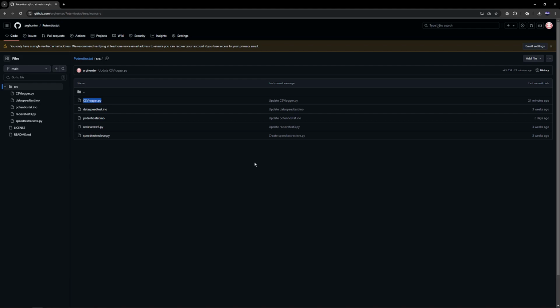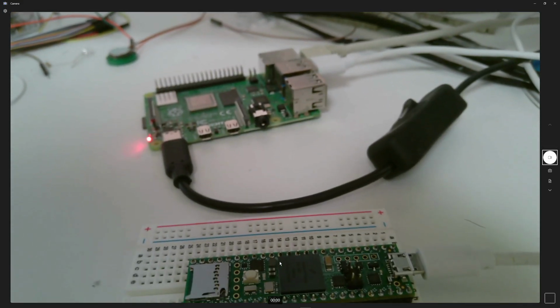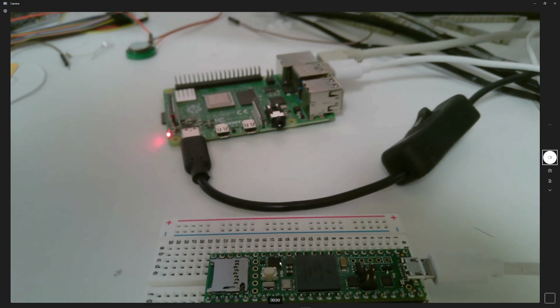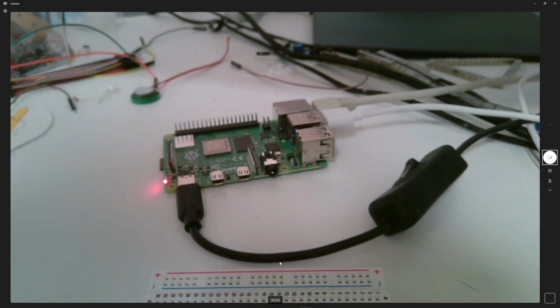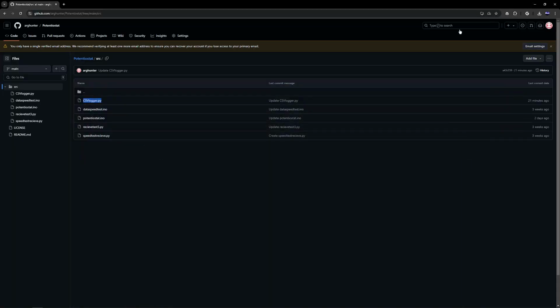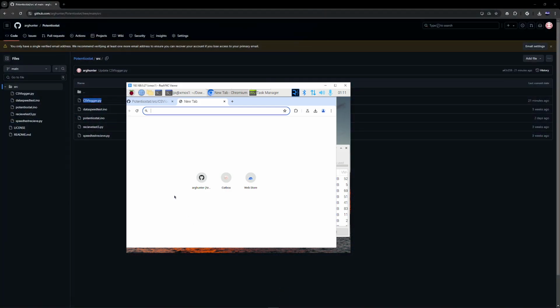Now to interface with the Pi, I've just connected it via USB. It's pretty simple. Just the Teensy over here, connected to a Pi through USB. Now this Pi is connected to the Wi-Fi as well. So what I've done is I've set up something called Real VNC that allows me to remotely access its desktop from my desktop, which is much nicer.